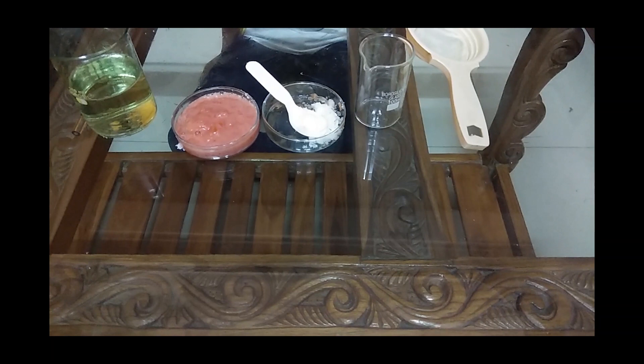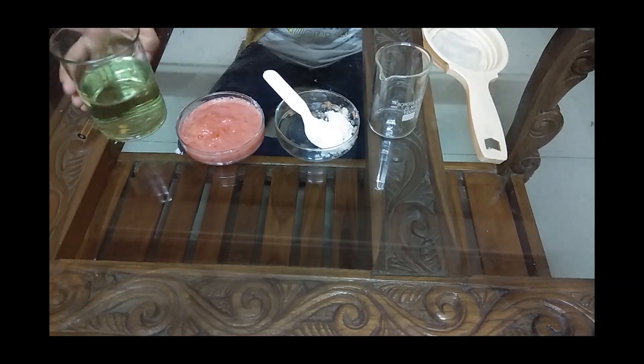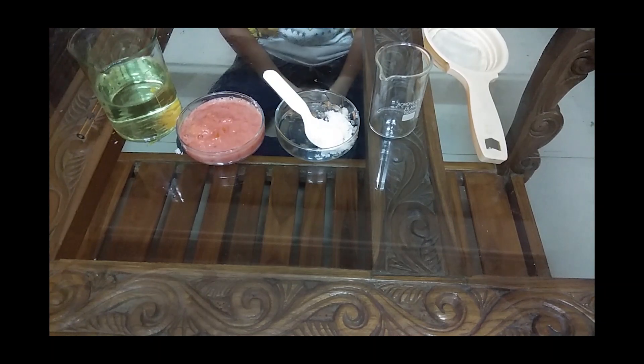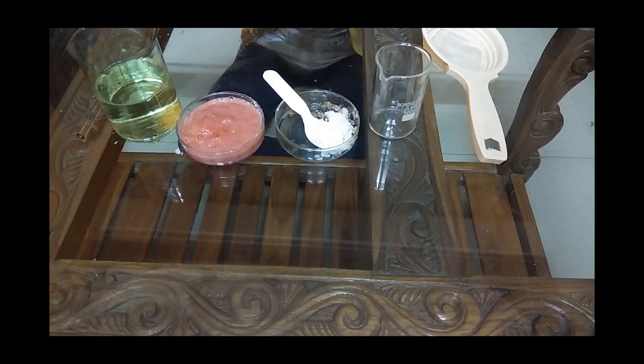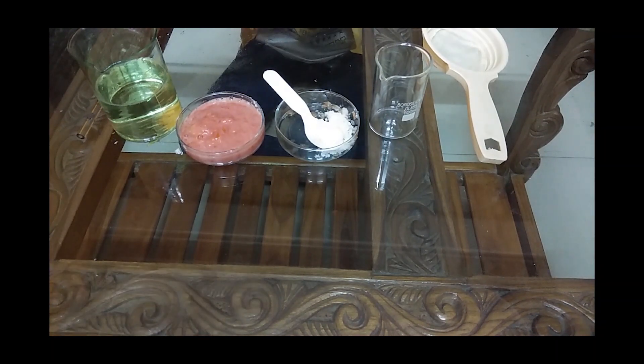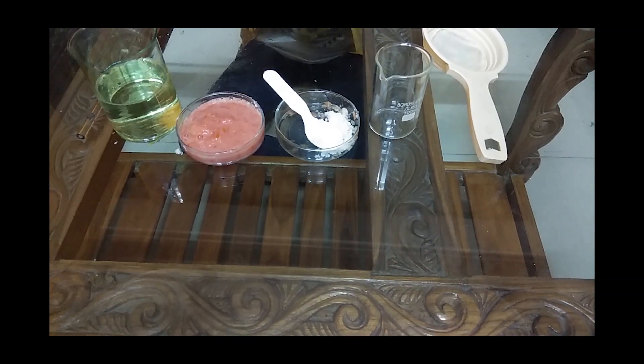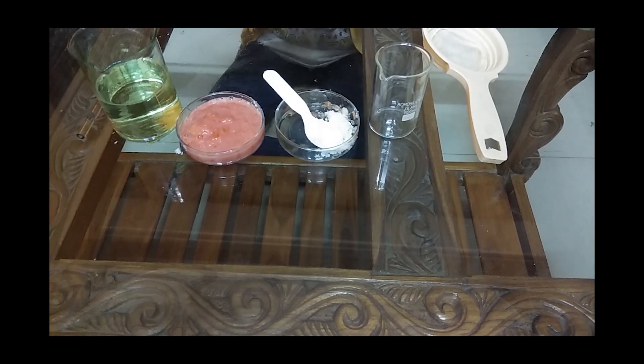These are the materials kept here. Can you see all the materials? This is mashed tomatoes. This is detergent solution. Detergents have stain cutters with enzymes like protease to digest protein stains. We are using it in place of all those enzymes. Then we have salt here - high salt concentration will allow the proteins to settle down.